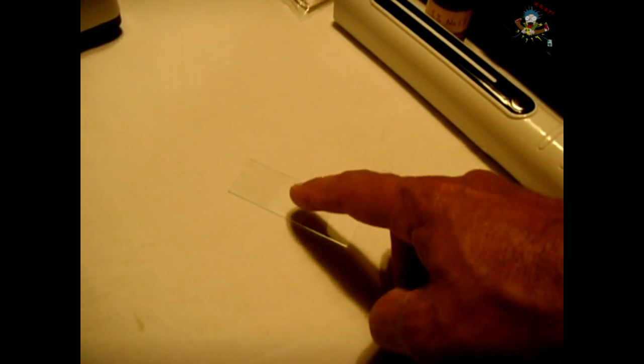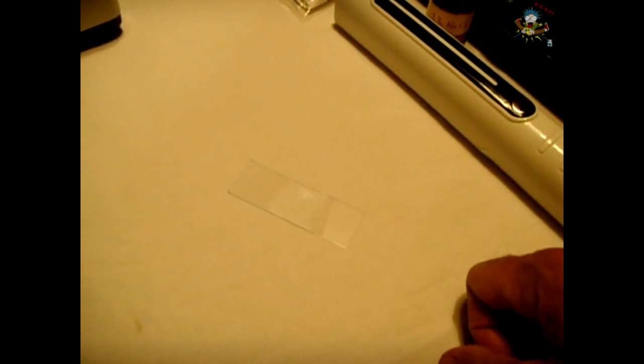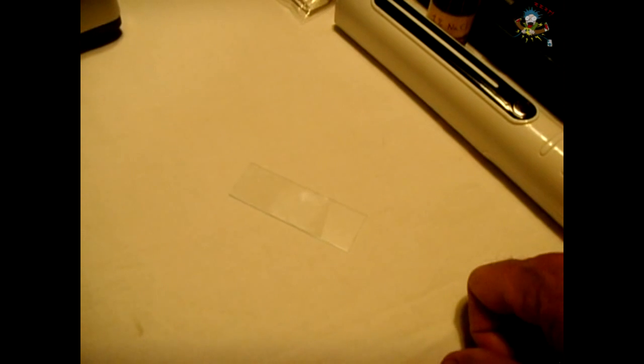We're now going to place the slide back into the microscope with oil immersion again and take a look to see if the bacteria are still moving. As you can see, after irradiating the slide with over one minute of UVC light, there is still plenty of activity with the bacteria on that slide.